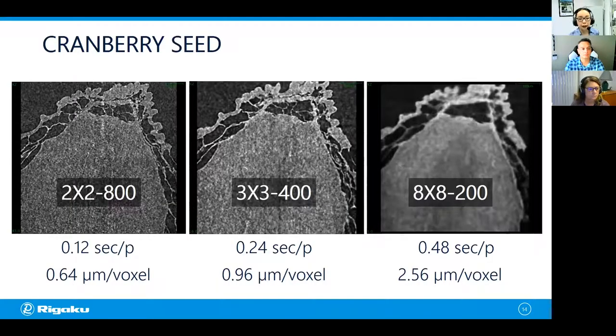So you can see that when the binning number is low, or the higher resolution conditions with higher number of projections, you get more noise, but the resolution is higher. In the middle, the 3x3 binning 400 projection scan probably is the best balance if you had only 2 minutes to do this scan, because those details are still there. You can see them and it doesn't look too different here. It's only just noisy with the 2x2 scan. By the 8x8 binning 200 projection scan, the resolution is too low in this case.